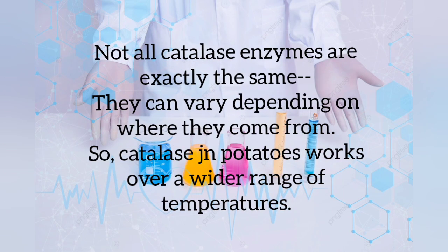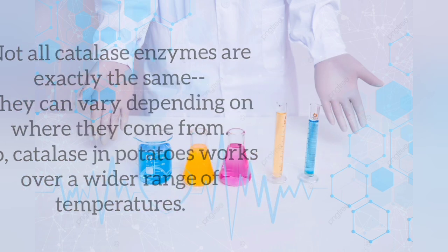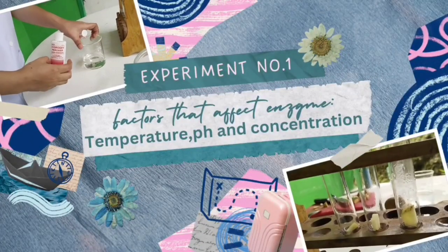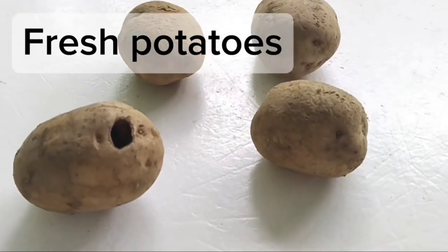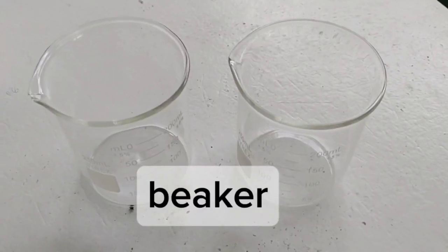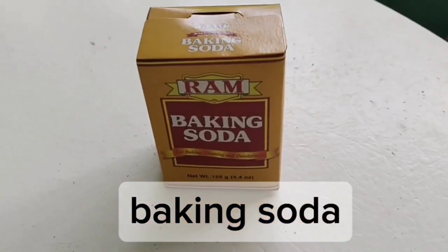Catalase in potatoes works over a wider range of temperature. Not all catalase enzymes are exactly the same, so they can vary depending on where they come from, like plants, animals, or bacteria. Experiment number 1. Factors that affect enzyme. Temperature. Materials: fresh potatoes, hydrogen peroxide, knife and cutting board, beaker, ice, baking soda.